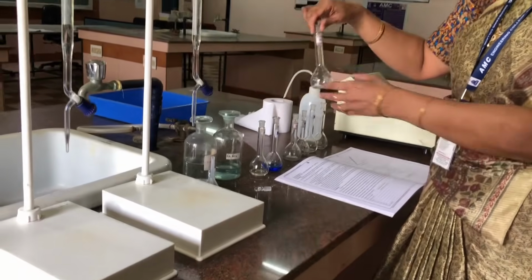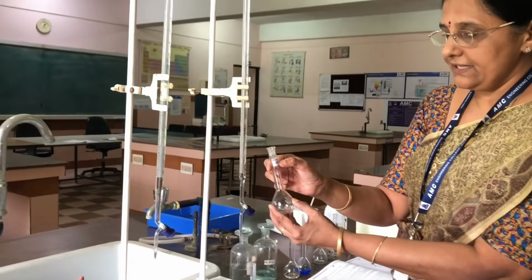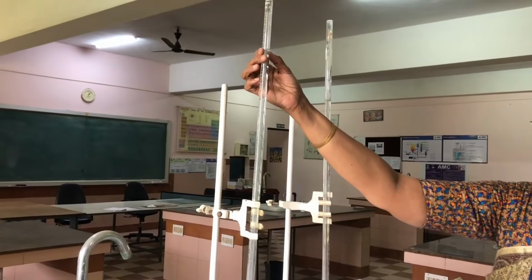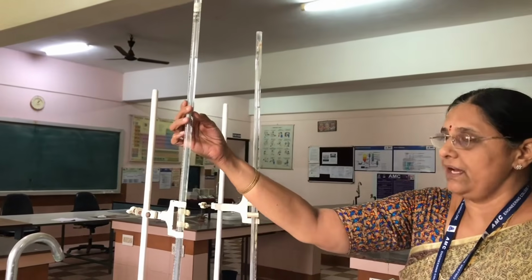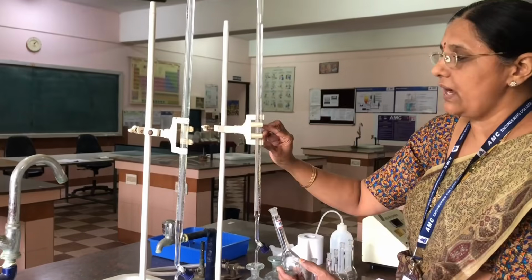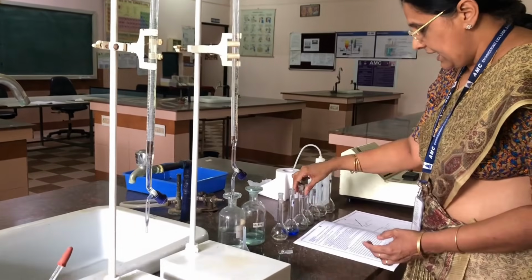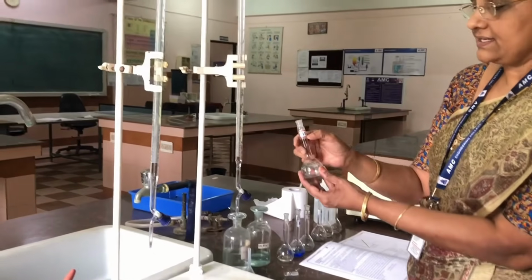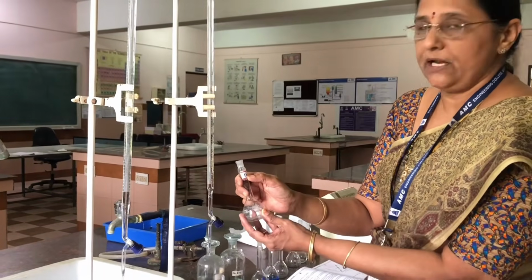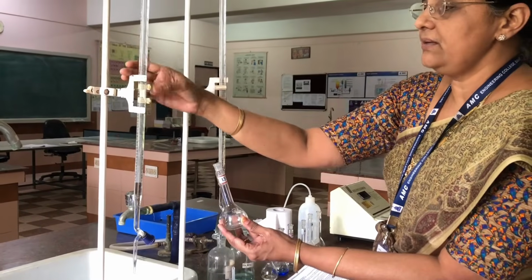And now I am taking the 10 labeled standard flask. In this, I have to take 10 ml of copper sulfate. That means already up to 5 I have added, so 10 ml means 5 to 15 ml. So you have to take 10 ml of copper sulfate, and again add 5 ml of ammonia into this and keep it here. Next we take the flask labeled 15, and in this we take 15 ml of copper sulfate. That means already it was 15, so 15 plus 15 becomes 30.